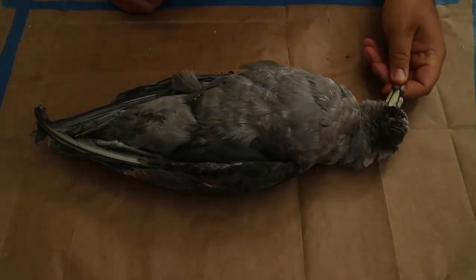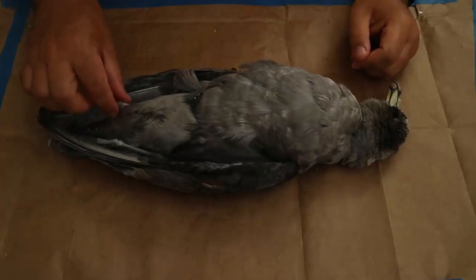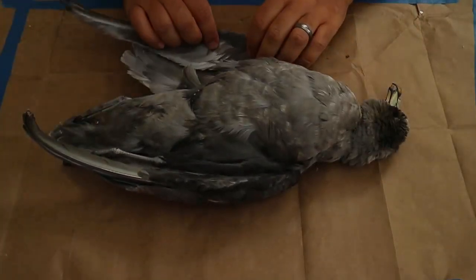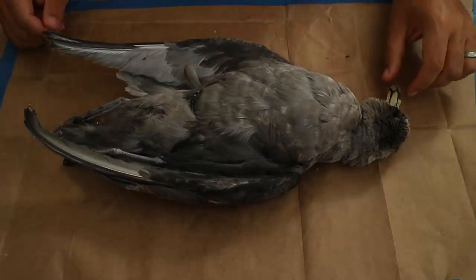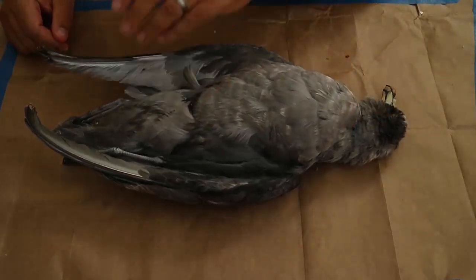What I'm going to do now is skin the bird and remove the skin so that we can create a study skin for the campus biological collection. This will be a skin that future students can learn from and study. So I'm going to skin this really quick.